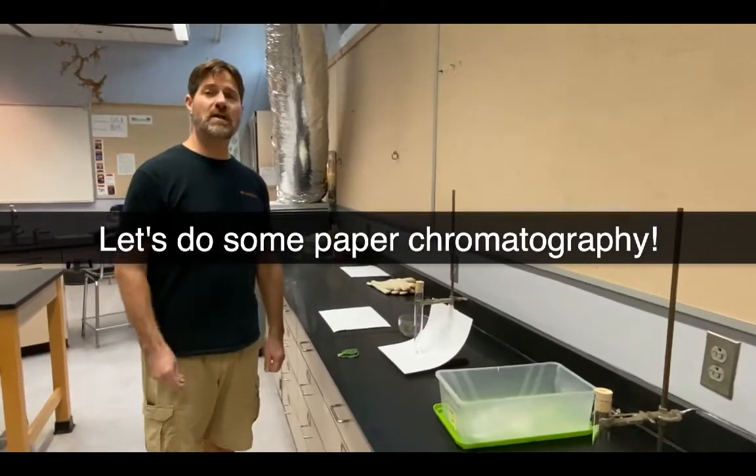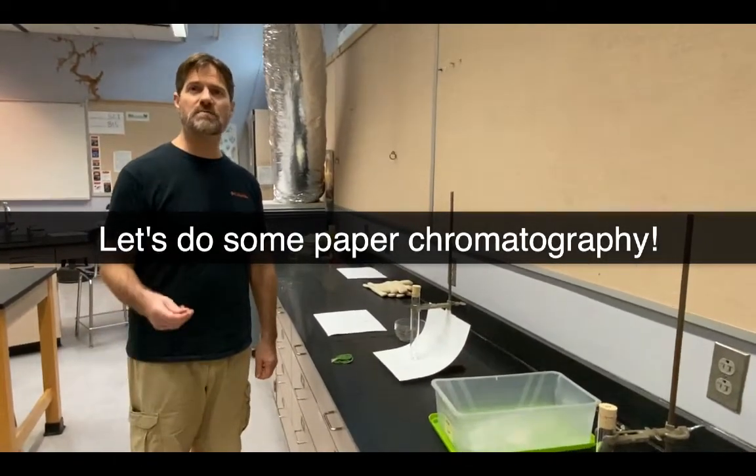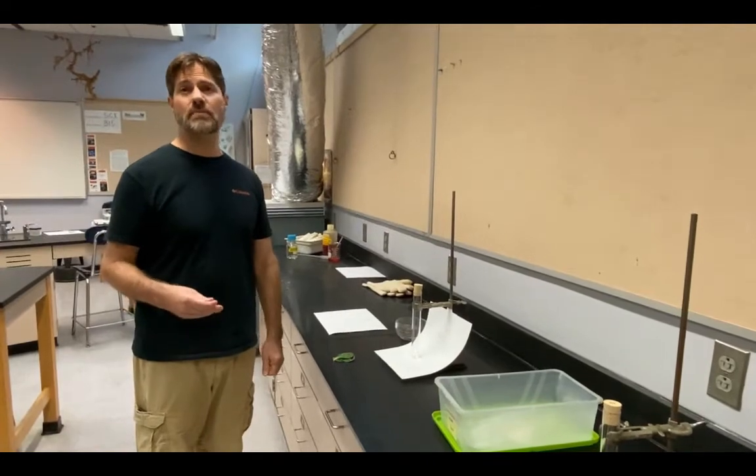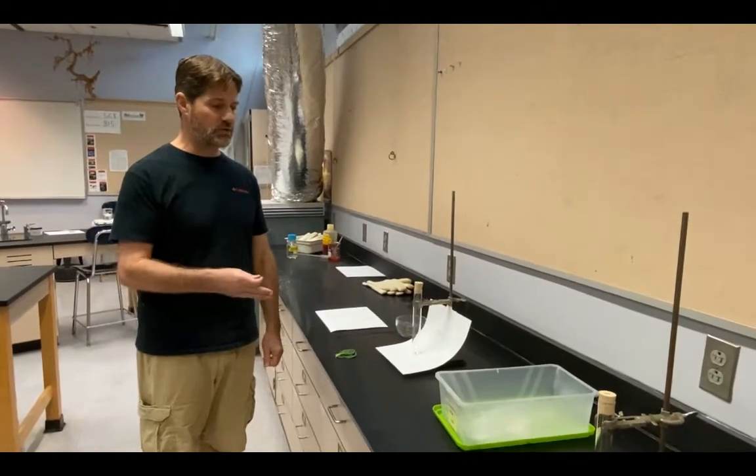Hi, let's get ready to do experiment number two. In this case, we're going to be doing some paper chromatography to try to separate the pigments that are found within a leaf.